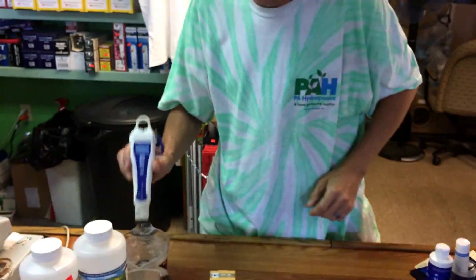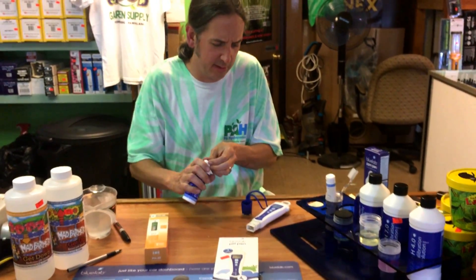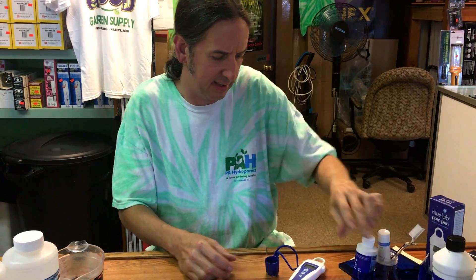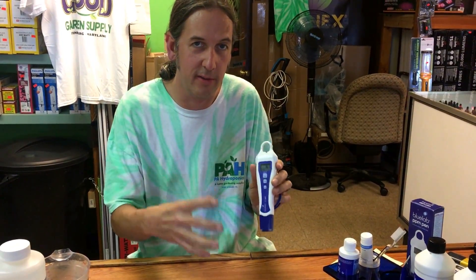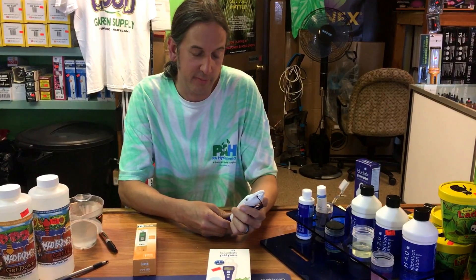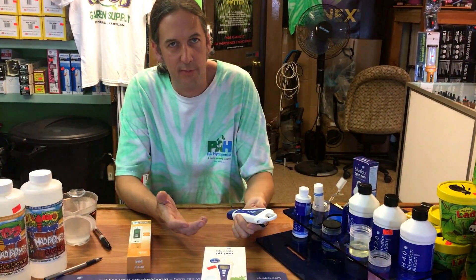I like to clean the probe off whenever I stick it in anything. I put a little bit of storage solution in the cap — potassium chloride will turn into salt as it dries out. When we got certified for Bluelab, they said you don't need the probe swimming in the cap — just keep it moist, since humidity from the liquid alone will keep the probe in good shape. If you let the probe dry out completely, a lot of people think that kills them, but they can often be brought back to life — just rehydrate them, soak them in storage solution overnight. But don't let your meter sit with nothing in the cap, or it will die prematurely.